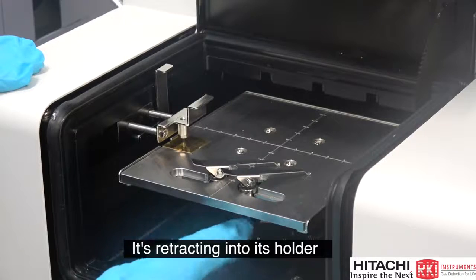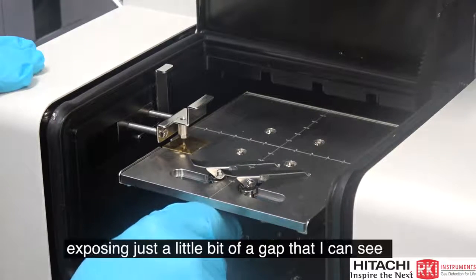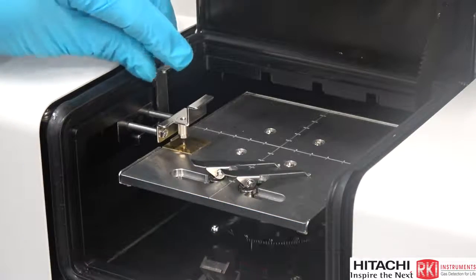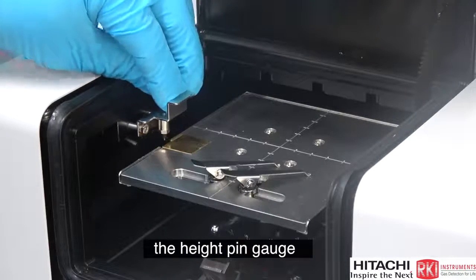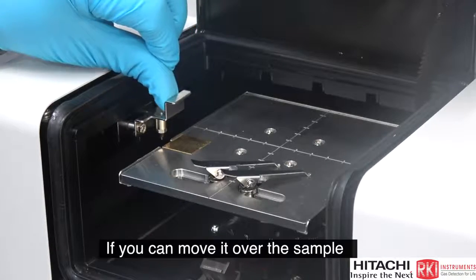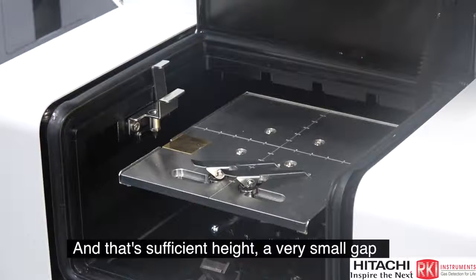It's retracting into its holder. Then I'm going to back off again just a little bit, going downward, exposing just a little bit of a gap that I can see. The way you can test that is to release the height pin gauge and then move it back over the sample. And if you can move it over the sample without moving the sample, then obviously you're not touching the sample, and that's sufficient height, a very small gap.